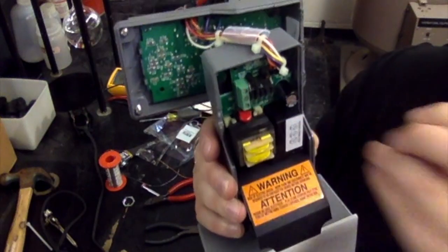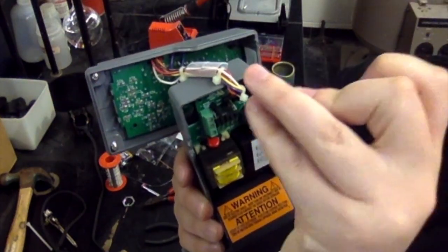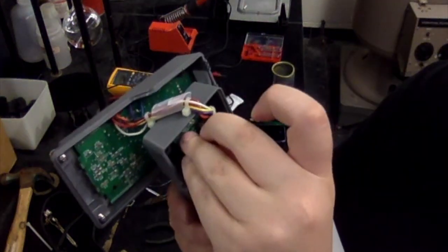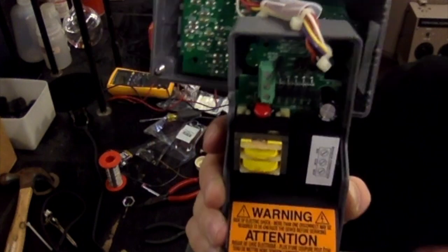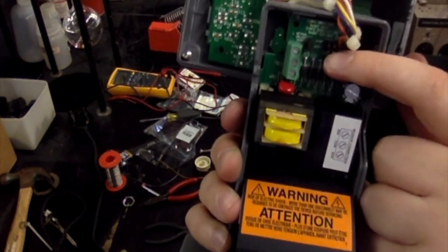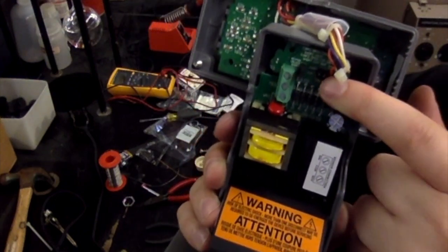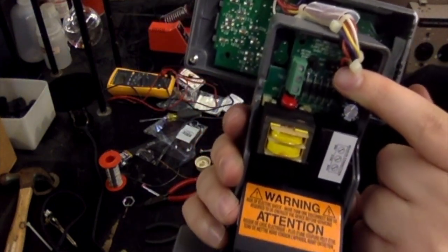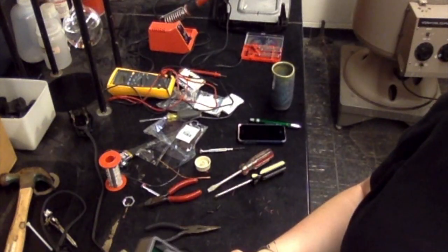So this is what they look like when you pull them out. They're just these kind of black covers. And you're going to move it over. So if you take them off, you can see it's going to be really hard to see, but there's just 4 prongs there. So at first it was just the 2 on the left that were covered. Now we're going to move the cover so that all 4 are covered. So let me go ahead and do that.